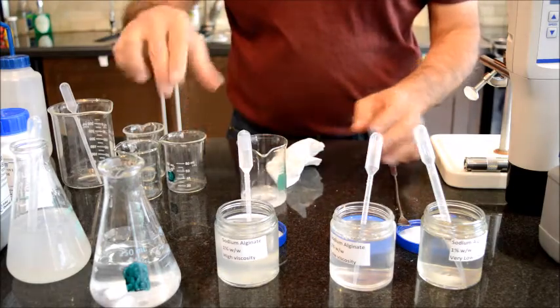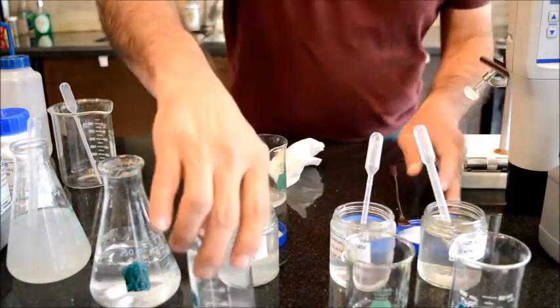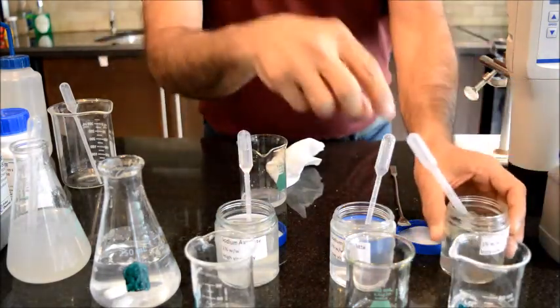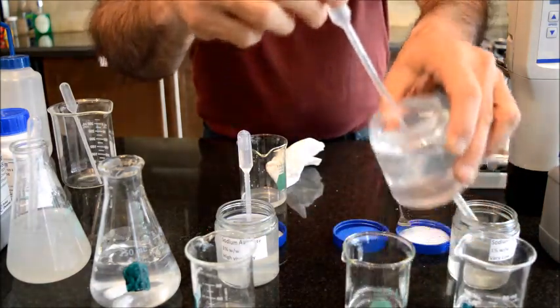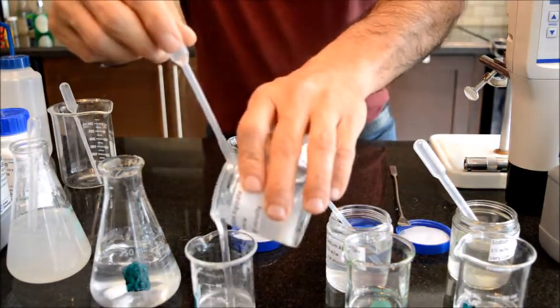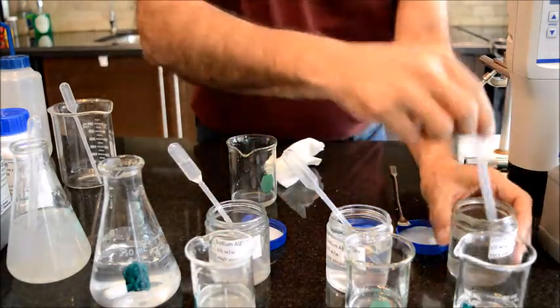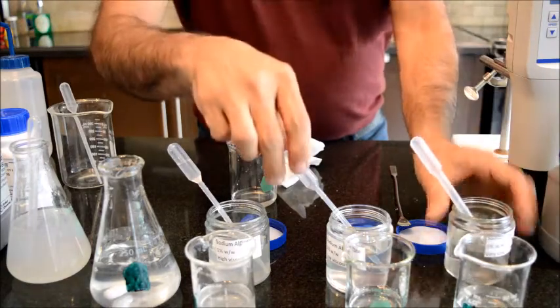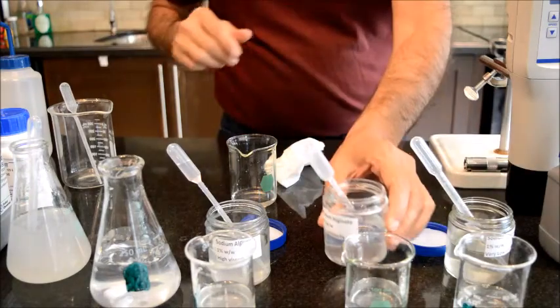I'm going to transfer this sodium alginate polymer into different beakers and show you that by adding the calcium chloride we will significantly increase the viscosity of this material. And you may see other videos about calcium chloride and alginic acid on YouTube, and they are probably more entertaining, but this is what I'm going to do today.